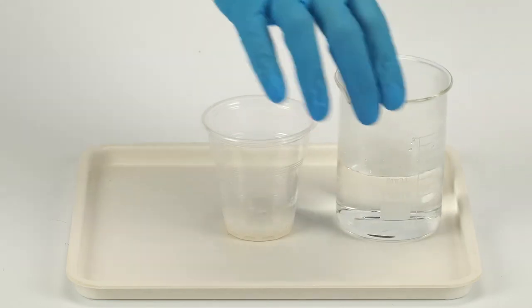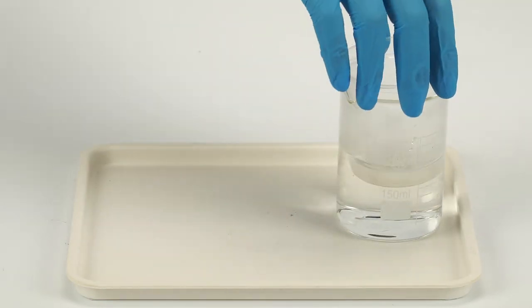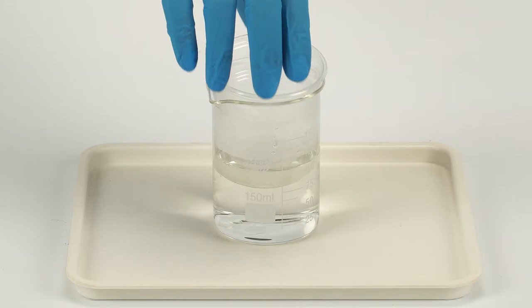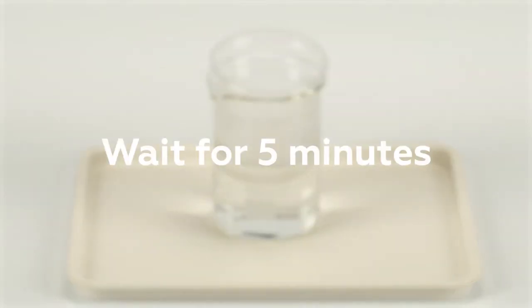Take the glass beaker and fill it halfway with hot water. Place the plastic cup with the mixture into your glass beaker. Let the mixture stand for five minutes.